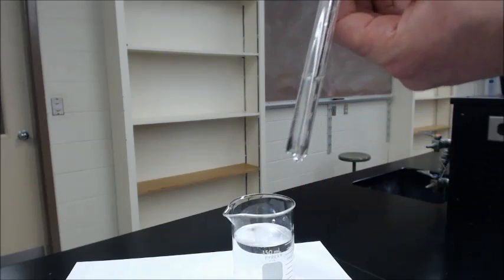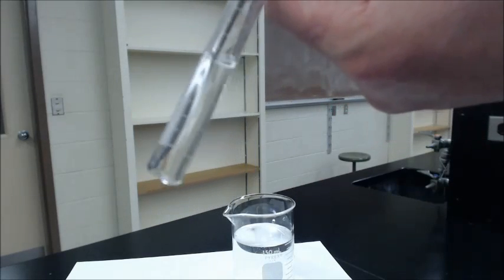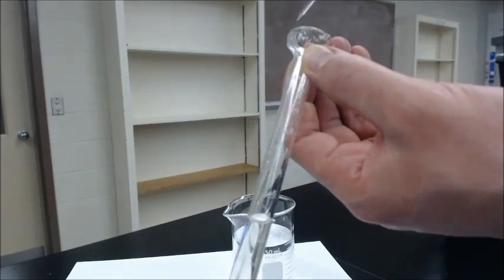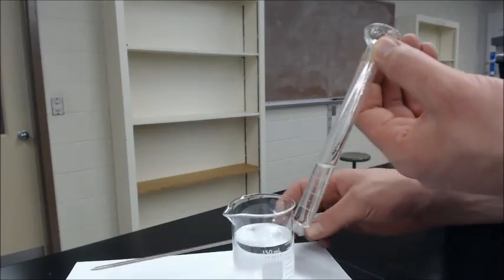So we've basically got it dissolved now. Very little left. So we're going to make a measurement of the volume.